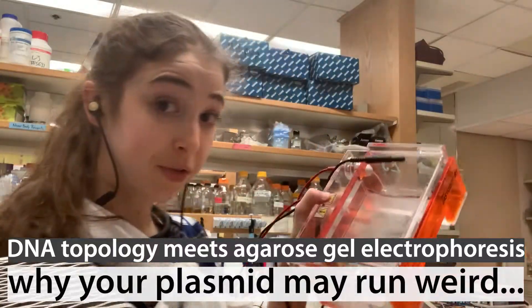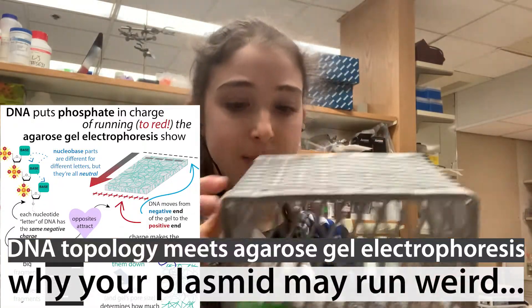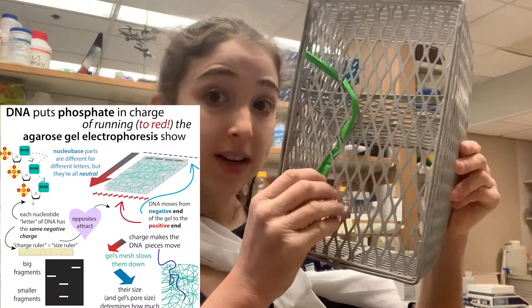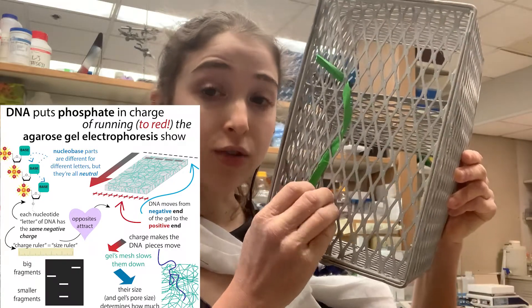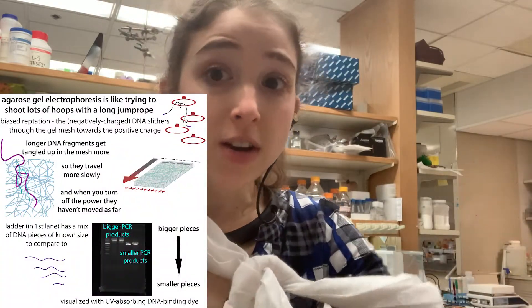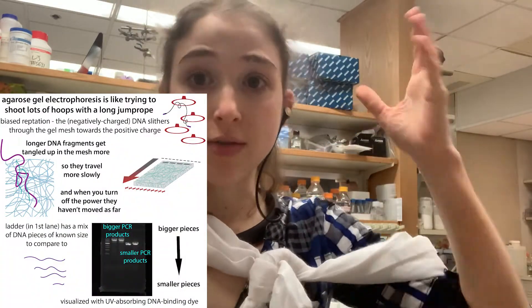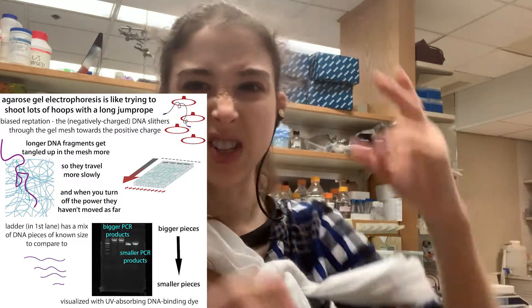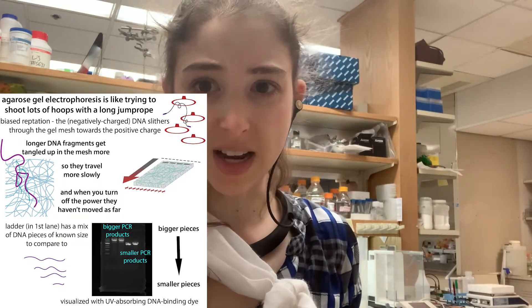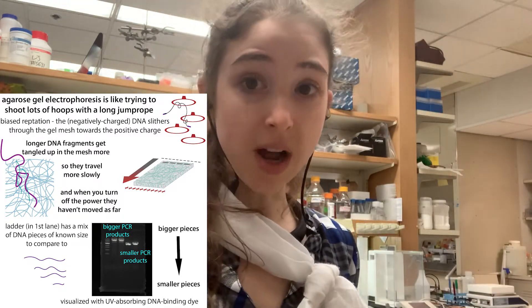When we use agarose gel electrophoresis to separate DNA fragments by size, the linear strands of DNA travel snake-like through the gel mesh. We even have a cool name for this: biased reptation. The longer strands get tangled up more, so they travel slower, and we can compare them to a ladder of known sizes to see how long the DNA was.